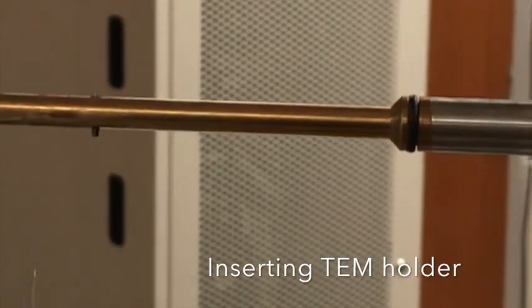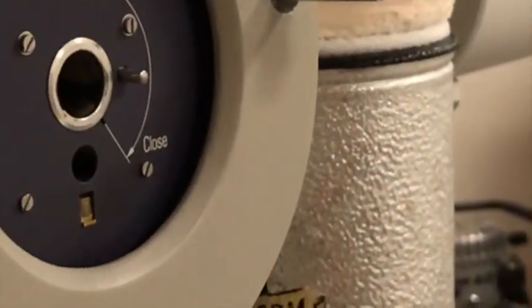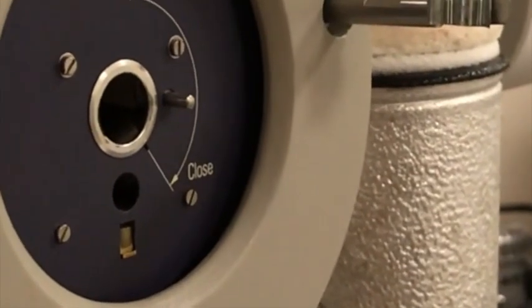There is a small pin on the TEM holder. The pin should be aligned along the close line when loading the specimen holder.